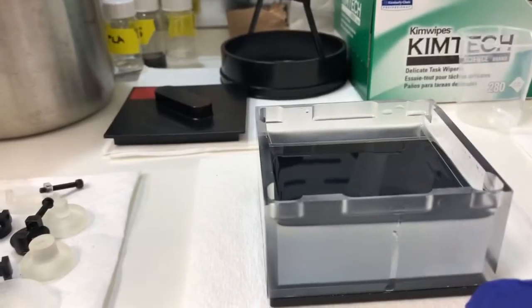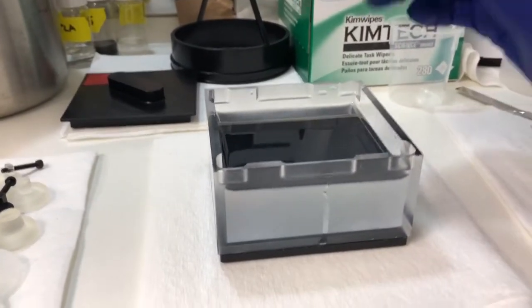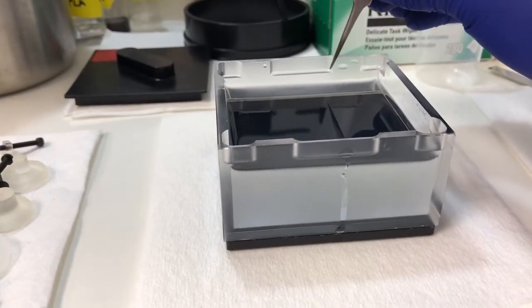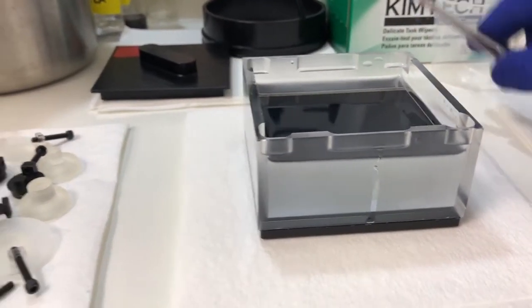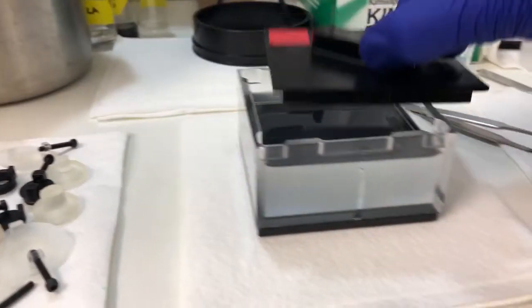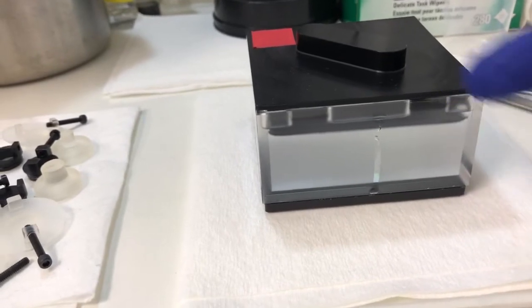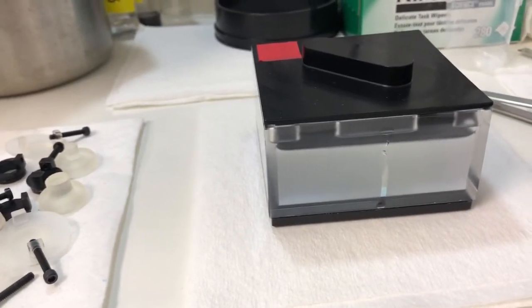The other thing is the level of DBE in the cuvette. We never want it to be above this line or really right at that line because that's where the lid comes on. If you have it that high, the DBE is gonna wick up and then out and that's just gonna make a mess.